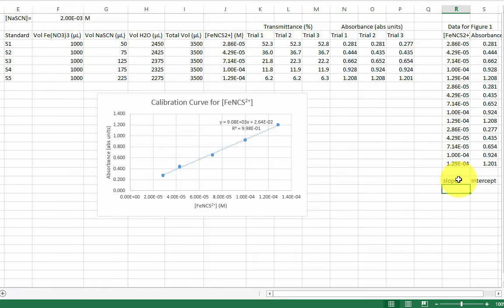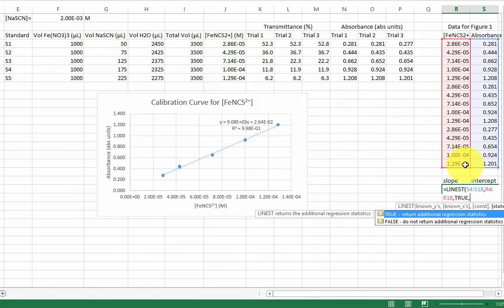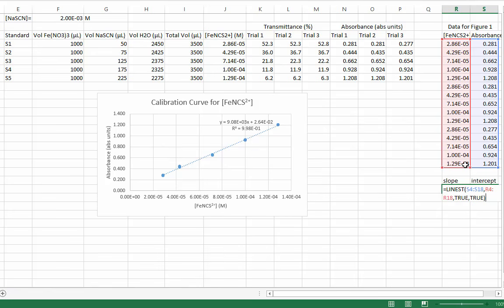Select two cells side by side. Type equals LINEST, open parenthesis, the y values, comma, the x values, comma, and true, comma, true, close parenthesis. This is an array function, so you have to press Ctrl-Shift-Enter. If you do this successfully, it will show the slope on the left and the intercept on the right. You can then use these values in future calculations and thus avoid rounding.